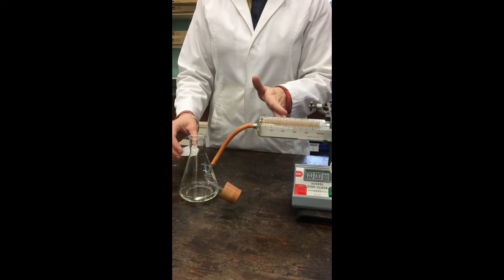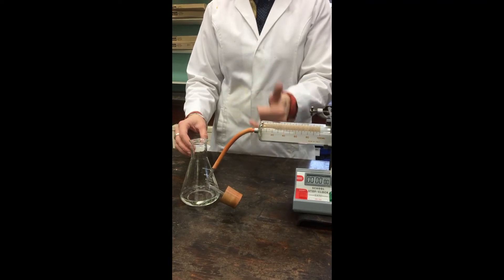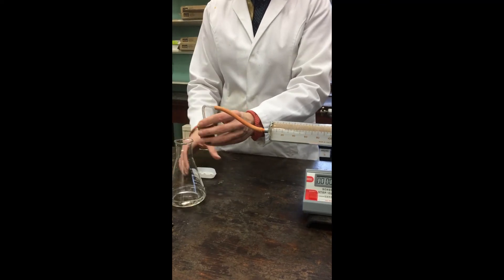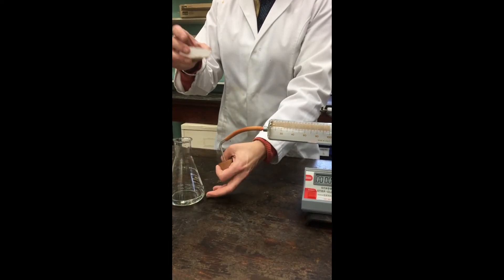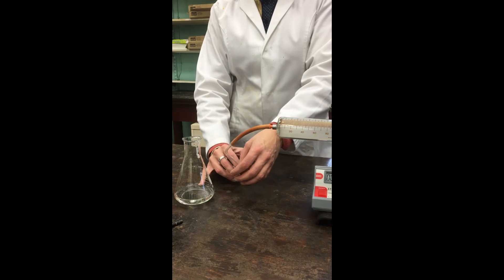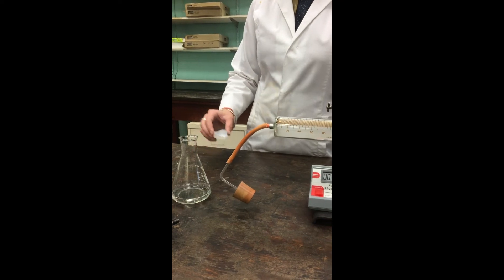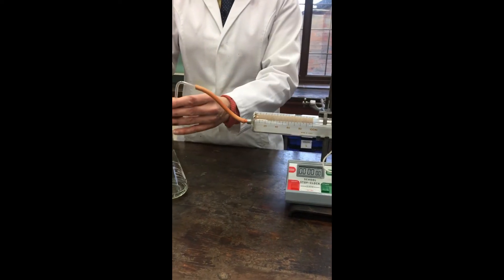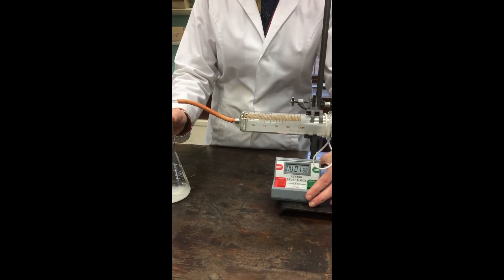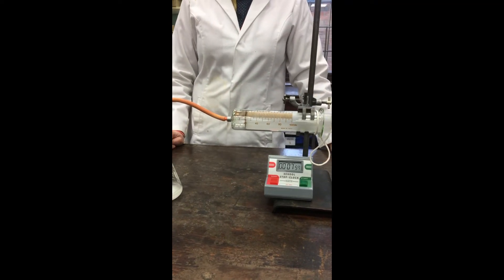Another way to measure the rate of a reaction where a volume of gas is produced is by using a gas syringe, which attaches to the top of a conical flask. I'm going to add marble chips — pre-weighed — to some pre-measured dilute hydrochloric acid solution, about 2 moles per decimetre cubed. I'll start the stopwatch, add the marble chips, put the bung on as quickly as I can, and then record the volume of gas produced over time.